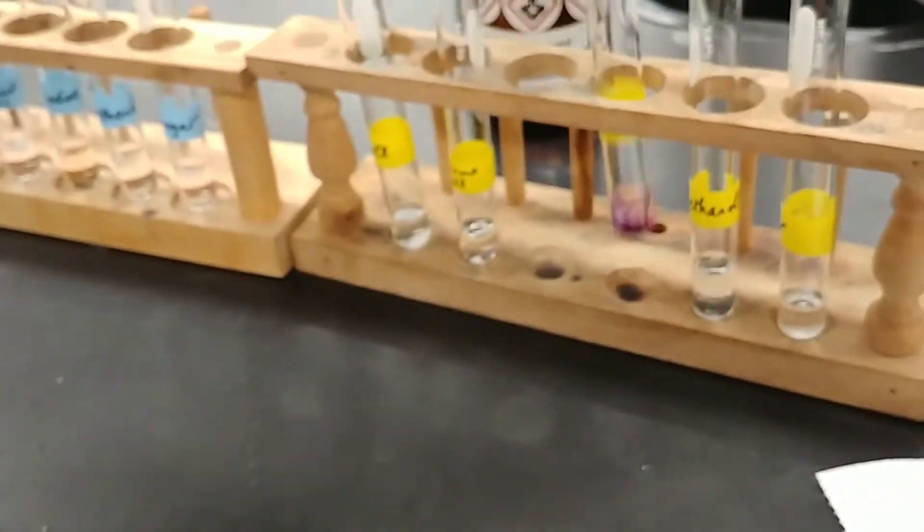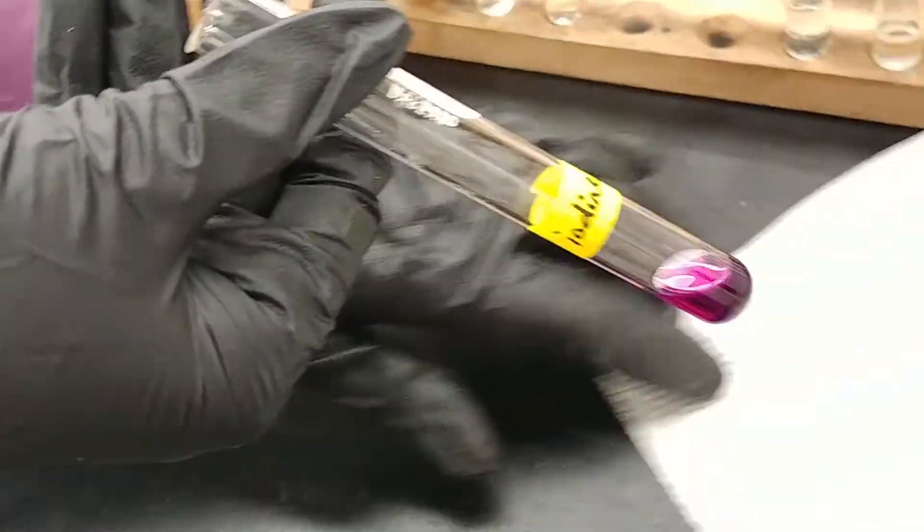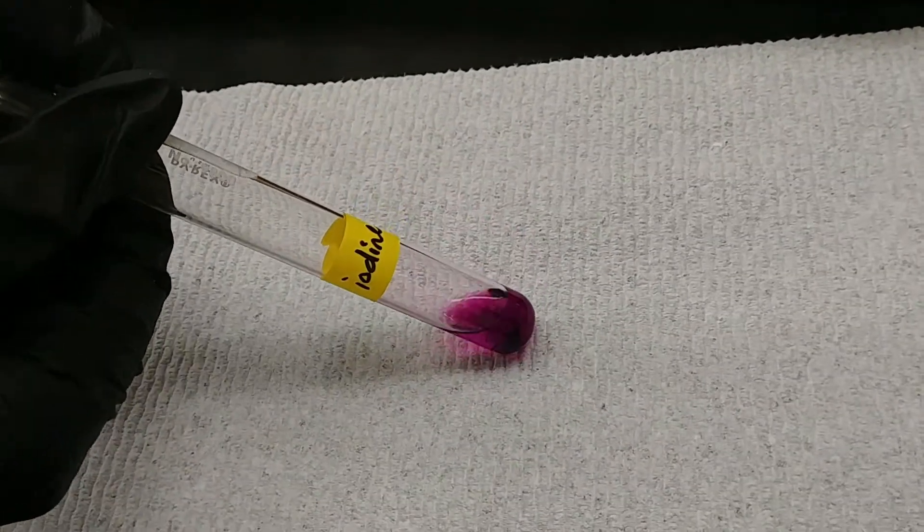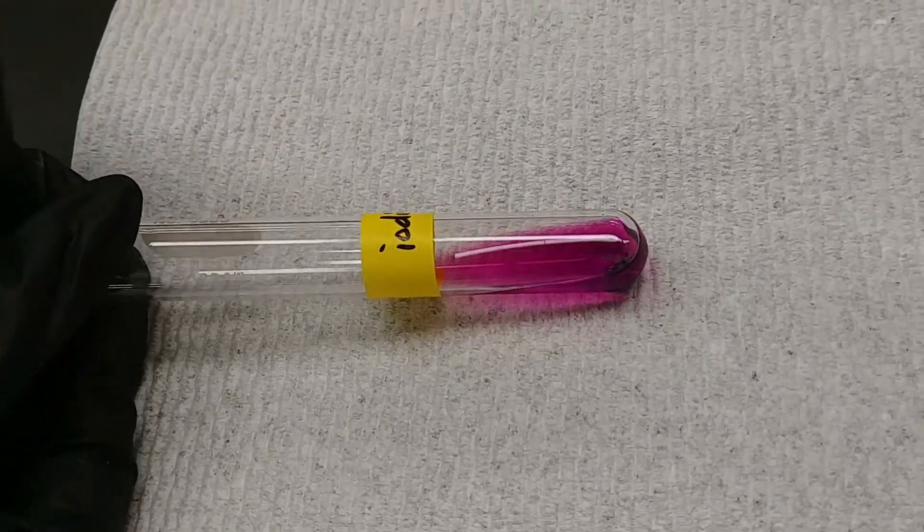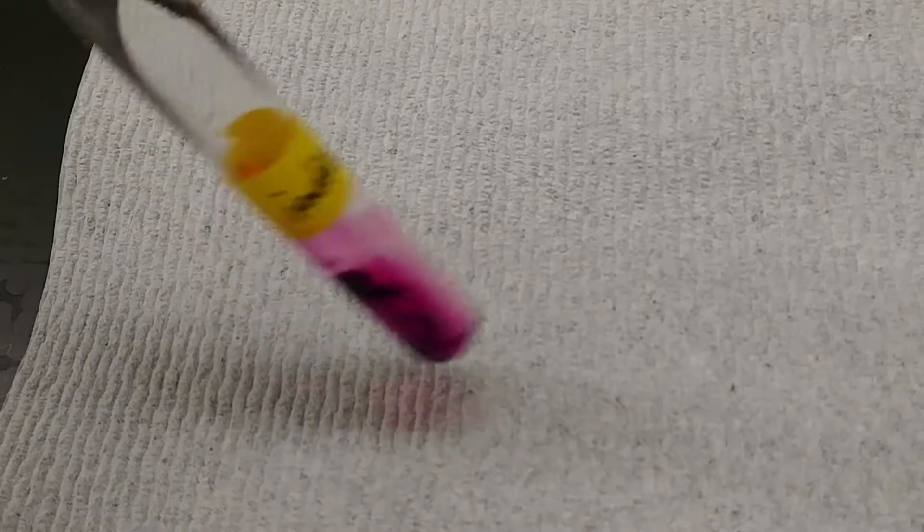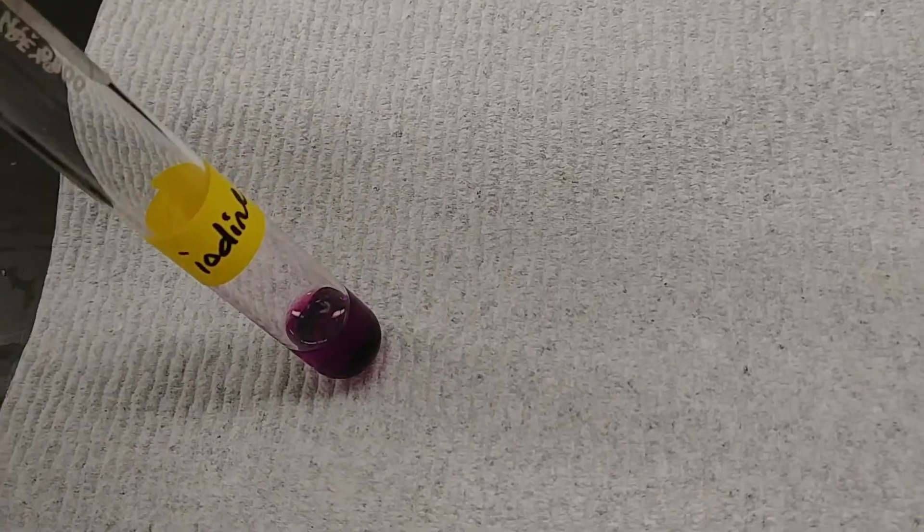Next up is the iodine. Now this one's pretty interesting. Again, we'll use a white background here to take a look. There's definitely a difference from what we saw with the water solvent.